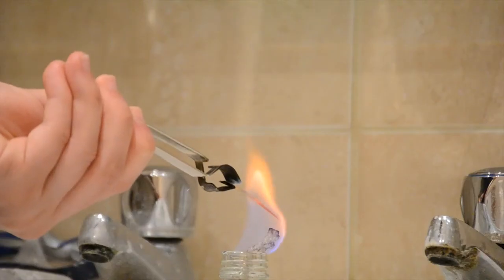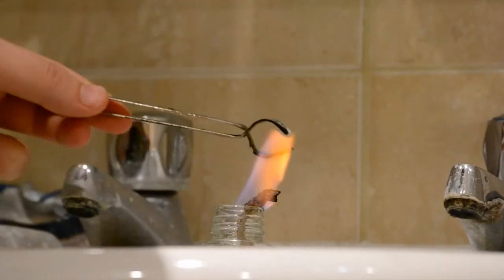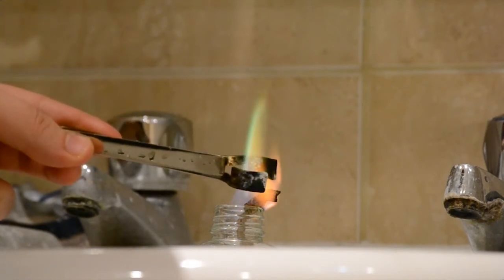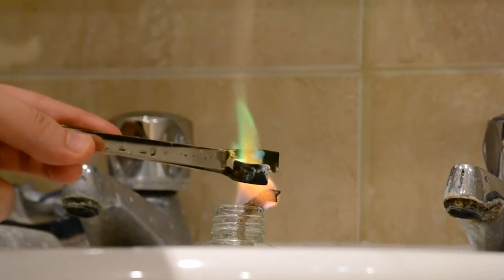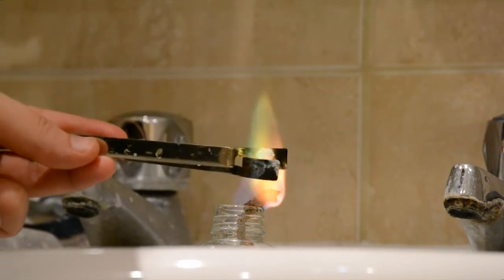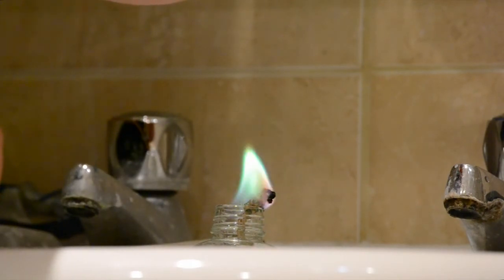My copper sheet just would not burn, but thankfully I had a stash of copper sulfate which put on a spectacular show of green flames. Taking a pinch of copper sulfate powder and throwing it into the flame worked even better.